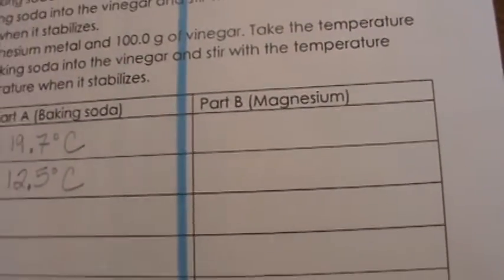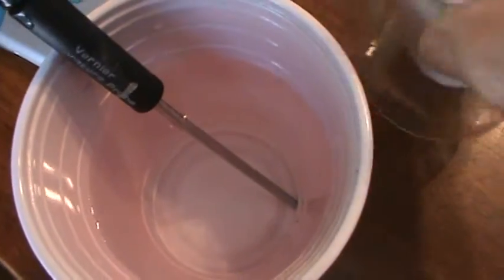All right, now we're going to go on to part B of part 1, and that's with the magnesium. Okay, so what I'm going to do for a moment here is I have this cold water, it's not really room temperature because I just took it out of my tap, but I'm going to go ahead and put my temperature probe in there. Okay, and that's just basically to wash my temperature probe from whatever was in it. And we'll start this again, and this time though we'll start this with magnesium.